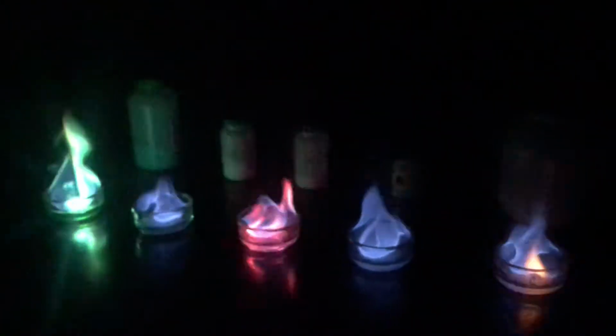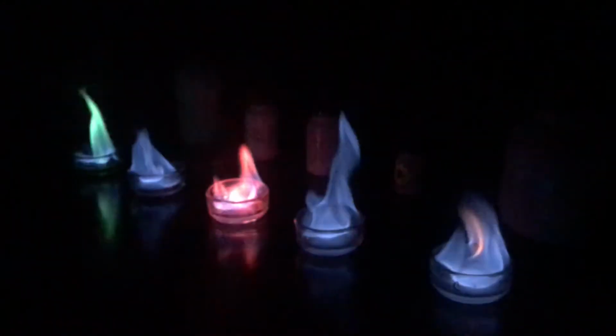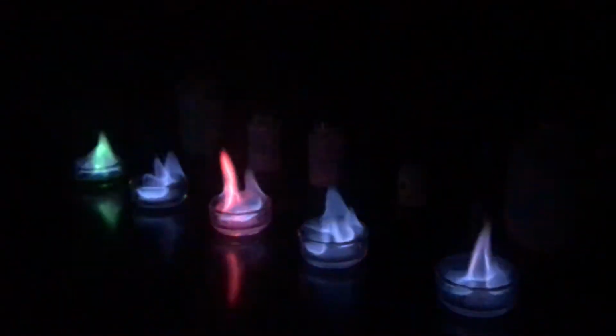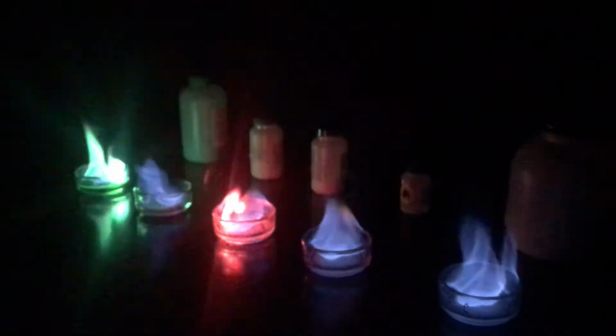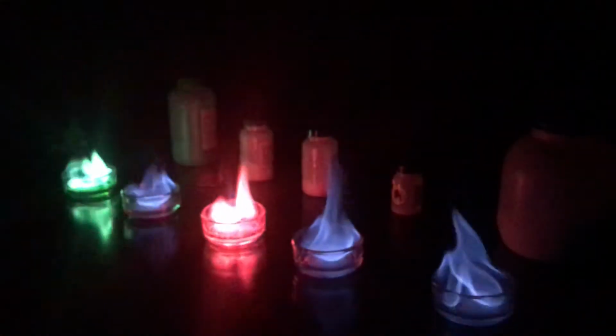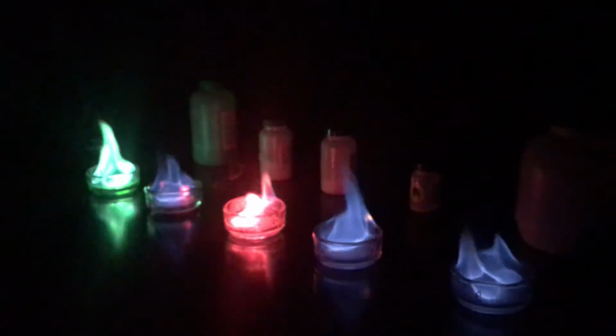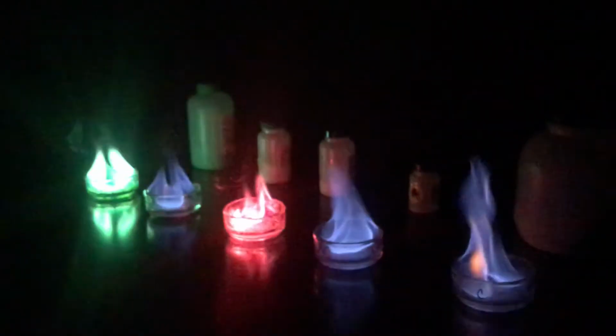It takes a lot of energy to actually get to see these different. You look at this and say they look the same, but if we were to have a device that could actually measure the frequency, you would see a much more orangish yellow color coming out of the sodium, and then the one on the very end is potassium. It's a little bit lighter. Can't always tell. The lithium in the middle gives you little flashes of dark pink every once in a while, but it's not showing up great. It just needs a little bit more energy to see that.